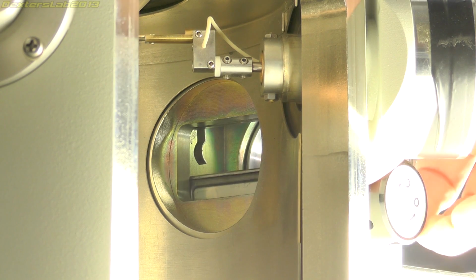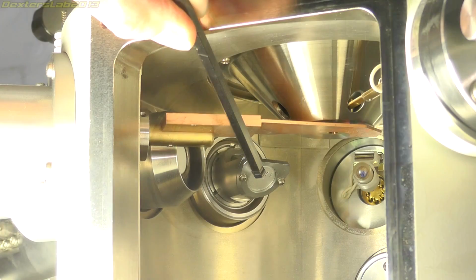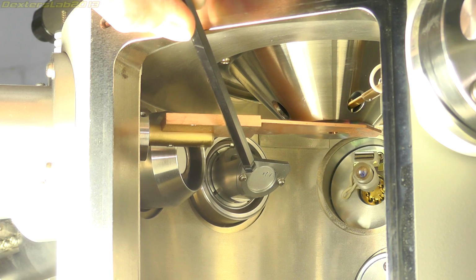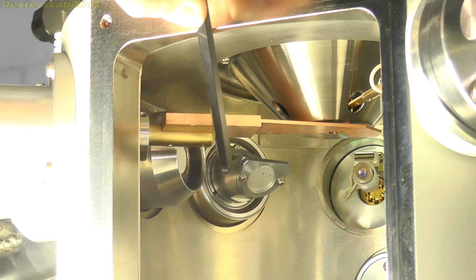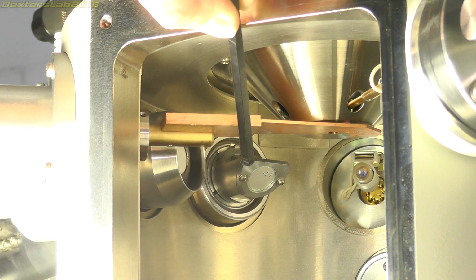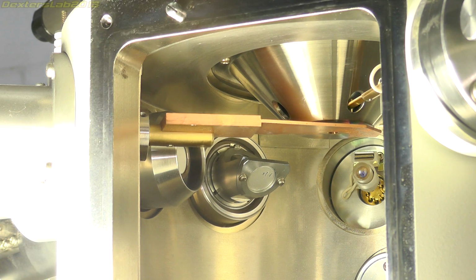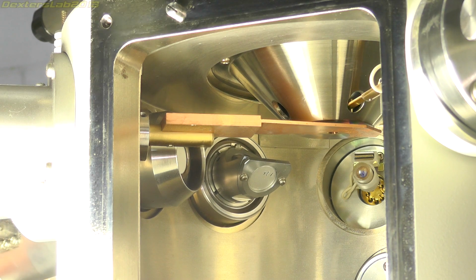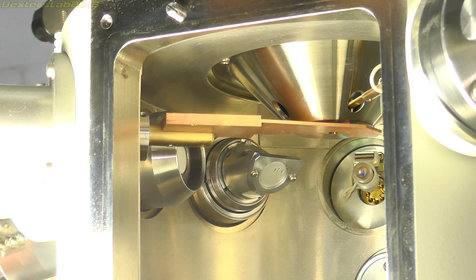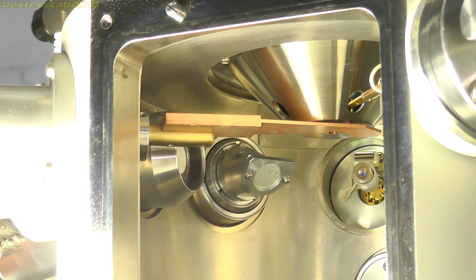So there's a small airlock system here. And on the other side of the sample chamber, we have this device here. That is the secondary electron detector, I believe. Next round, we have this device here, and I believe that is the X-ray detector. The electron detector there can actually be moved in and out with a control just here. So that can be moved into position from the outside.